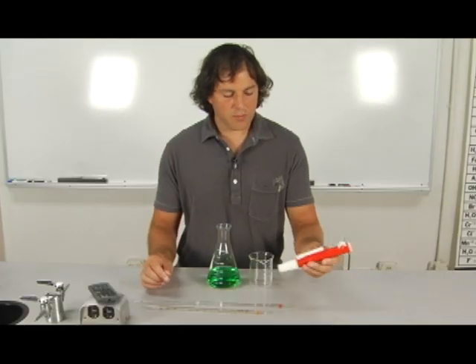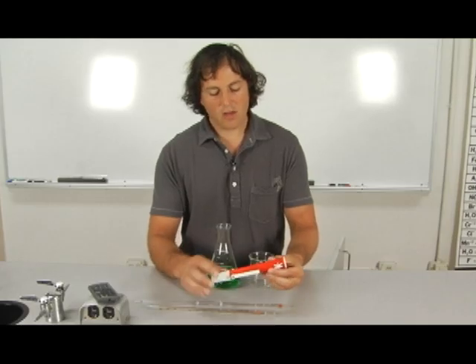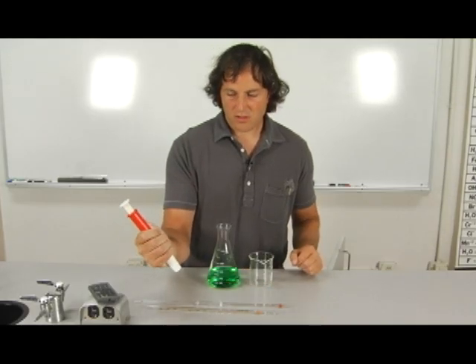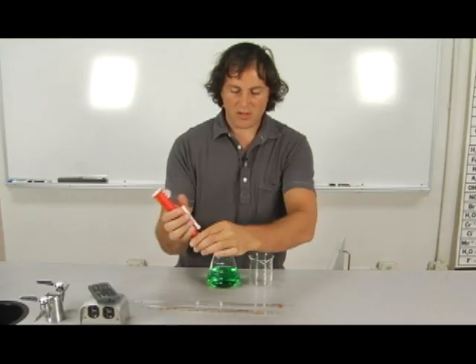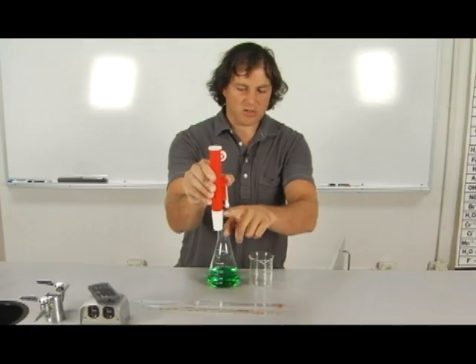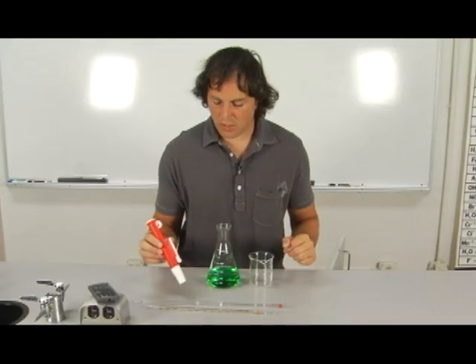When we're using a pipette and a pipetter, there are two functions on the pipetter. One is a thumb valve that allows you to draw the vacuum and the other is the outlet valve. We push this and air is just allowed to come in. This is similar to letting your thumb off of a straw and the fluid flows out.